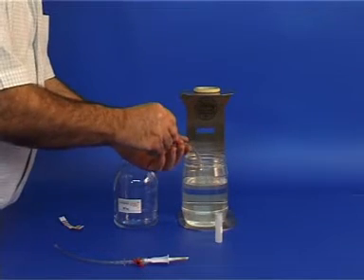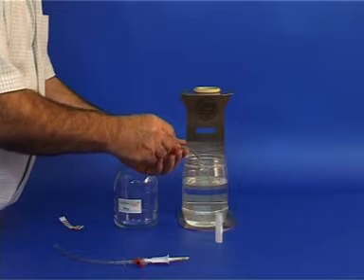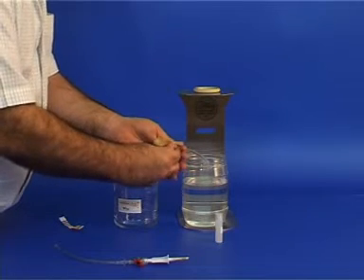Draw a small amount of water and close the valve by turning it to a position perpendicular to the needle axis.